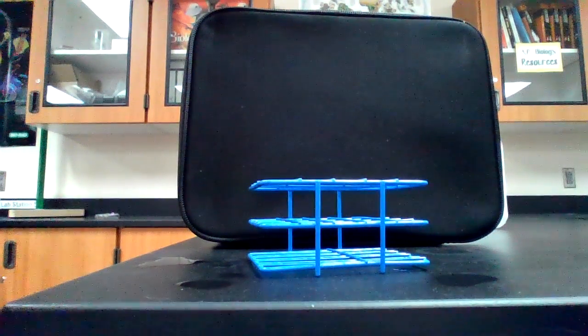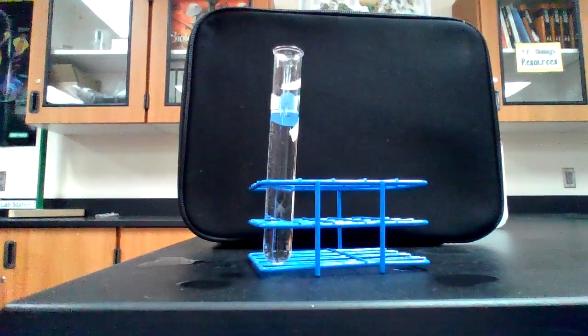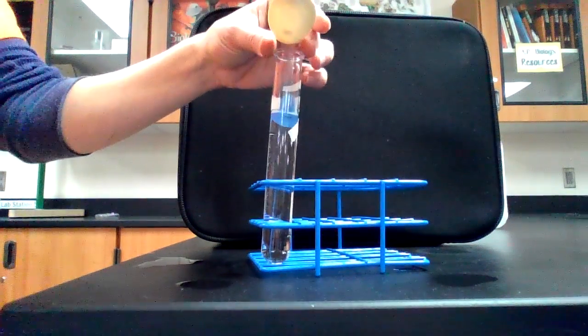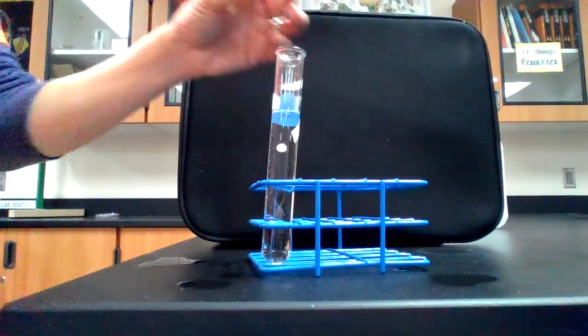So we're going to keep going until we get hopefully 5 good trials. So far we've had 2 that actually sunk all the way to the bottom. So we will count those 2 and discard the others as some kind of error. So this is hopefully our 3rd good trial. On your mark, get set, go.